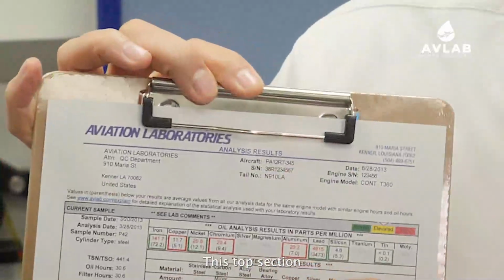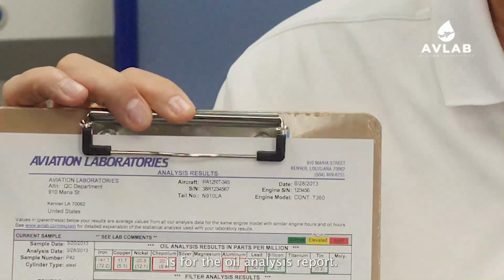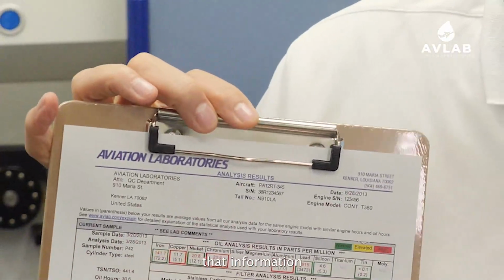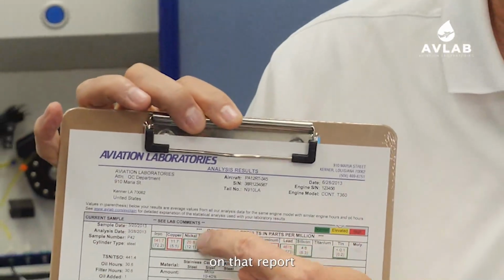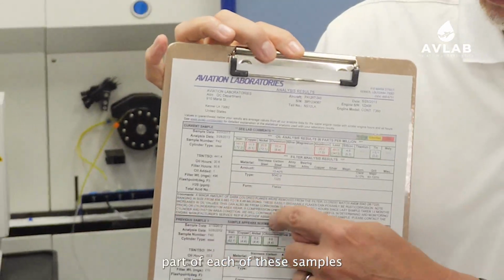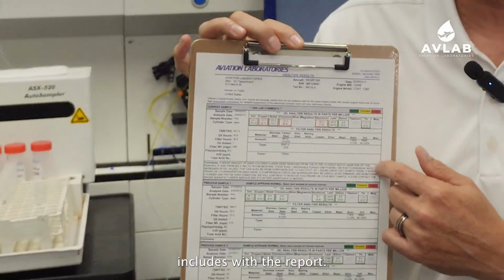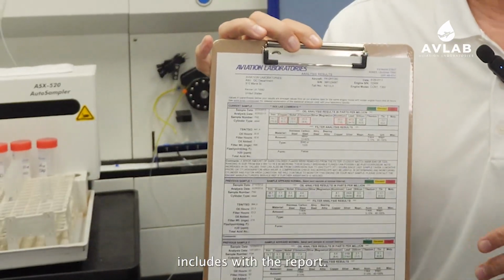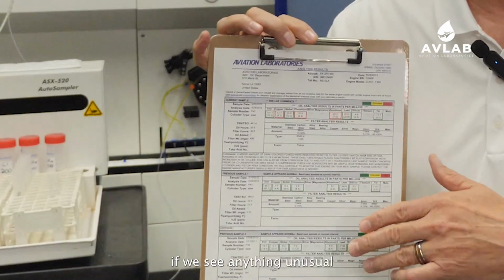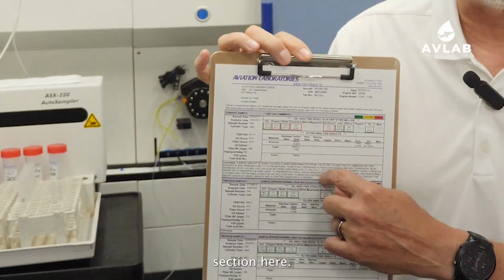This top section with the colors on it is for the oil analysis report, and if you sent us an oil filter, that information will be a little bit lower on that report, down in this section here. And then the bottom part of each of these samples contains comments that our lab manager includes with the report. If you have any issues, if we see any high metals, if we see anything unusual with your sample, we'll put that in the comments section here.